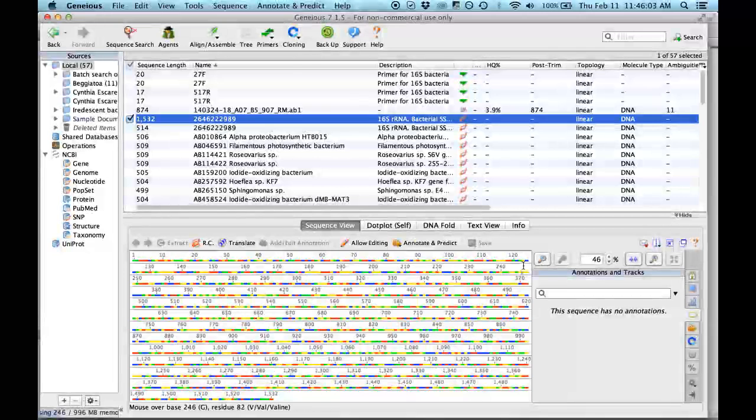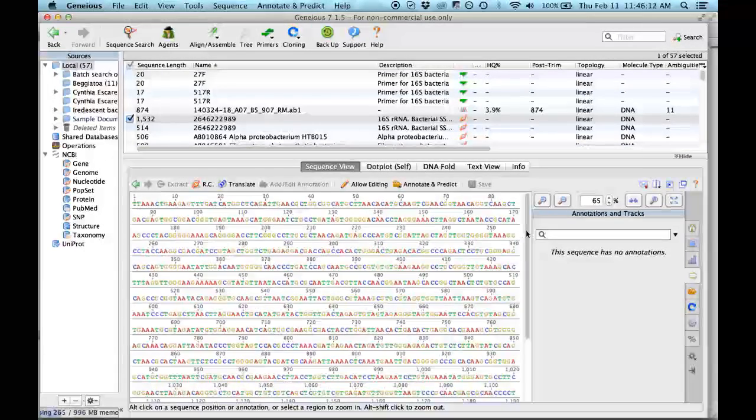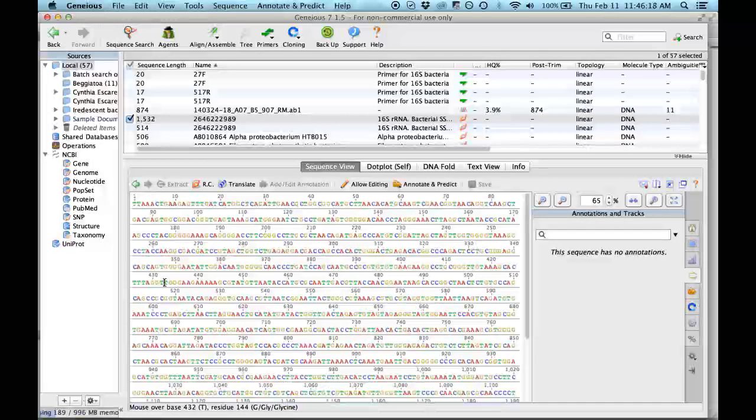So here it looks like that, but if you press here, it shows all the nucleotides, really similar to how you have it in your presentation. Here is where I messed up, because I read that the negative strand goes from 3' to 5', and I did the reverse complement thinking I had to put it in 5' to 3', but the program already gave it in the positive sense. So I don't have to make any change. That is why I messed it up during the ECODIM and gave you the wrong analysis. Now I will show you how to do it correctly.